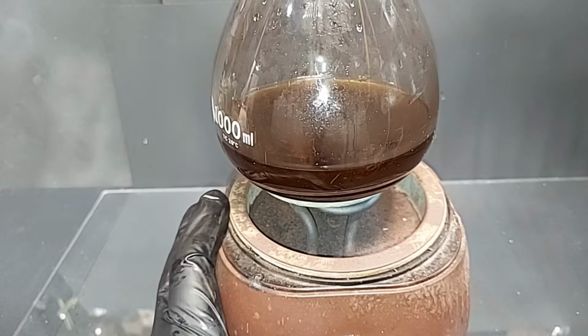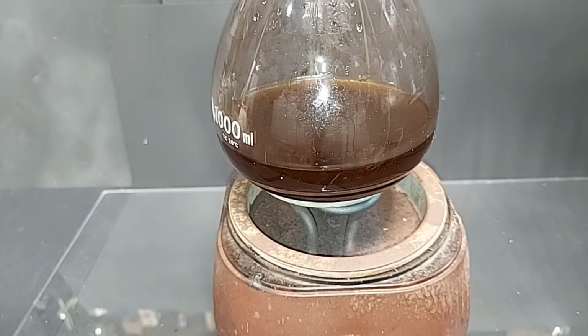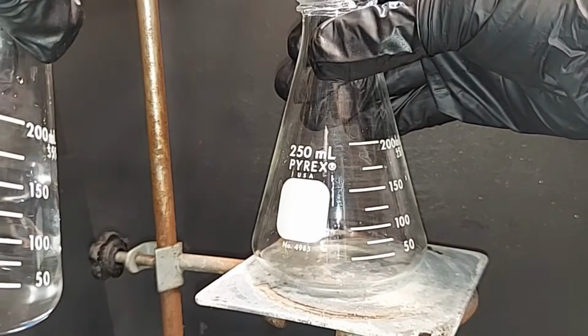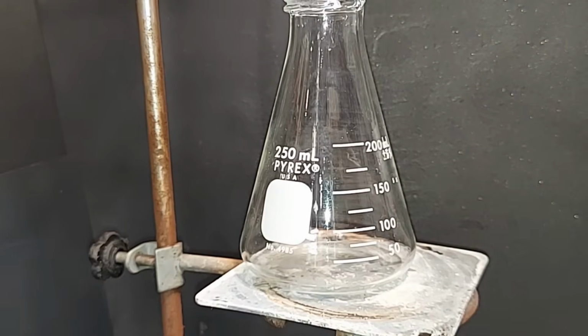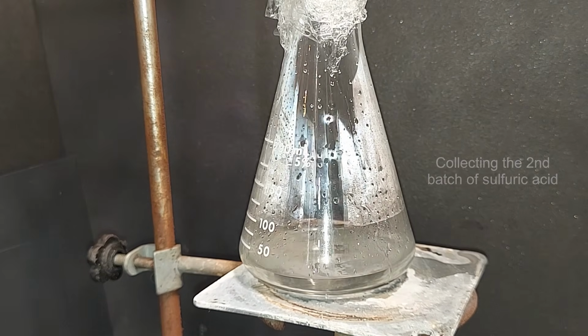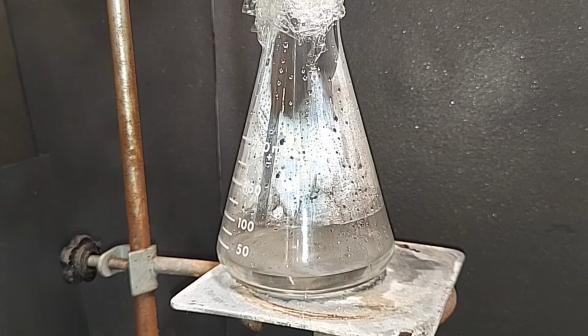Turning this on. Because you've seen this already, and I really don't want to bore you, I am only going to put up the video of collecting the acid on the other side. Done collecting mostly water and swapping out the flask now for more of the sulfuric acid. The sulfuric acid has stopped dripping over, so I'm going to let this calm down again, and I'll disassemble this, and we'll combine both flasks together.